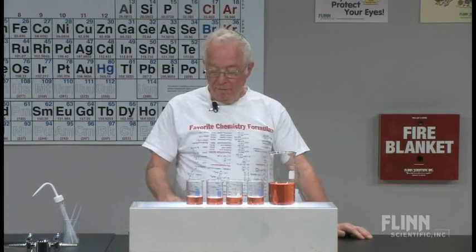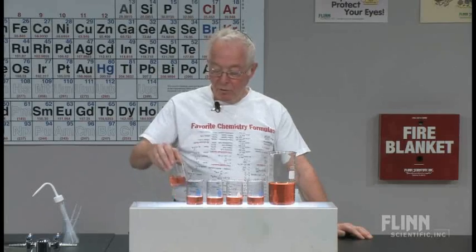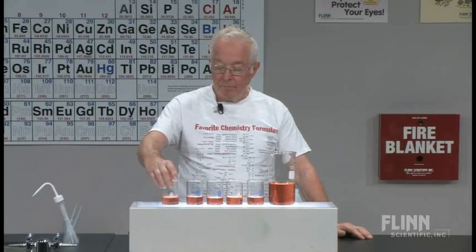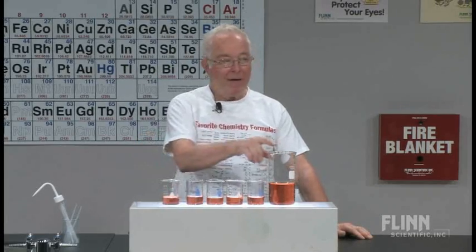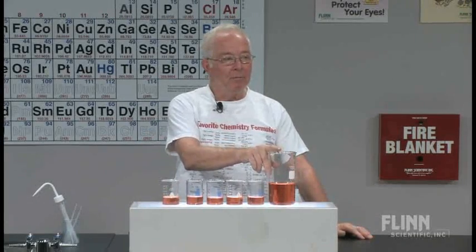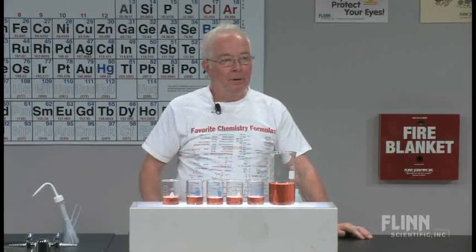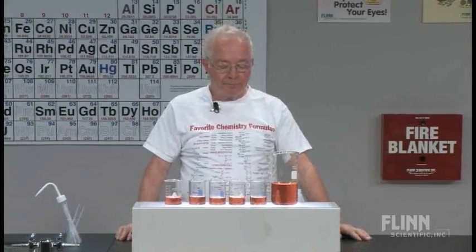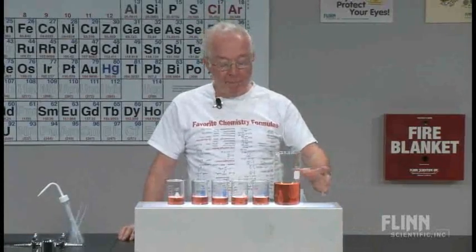But all of these solutions, including the one I took away, all came out of this beaker. How can it be? Let me demonstrate.